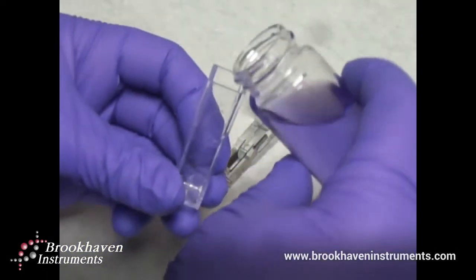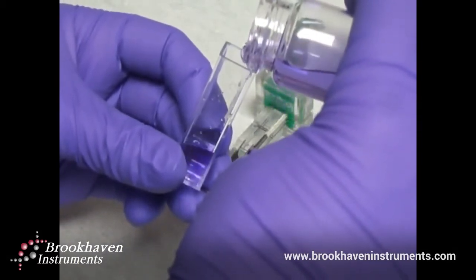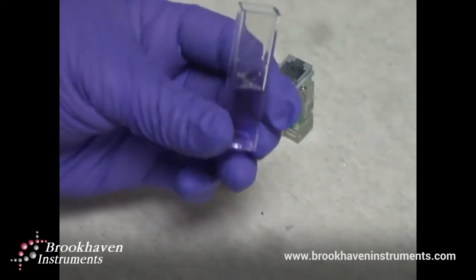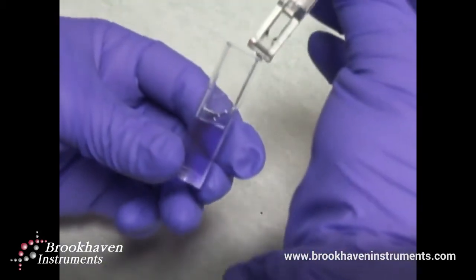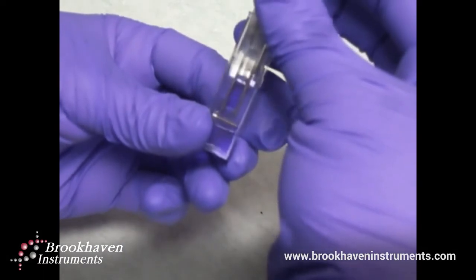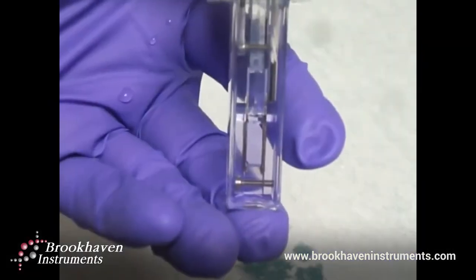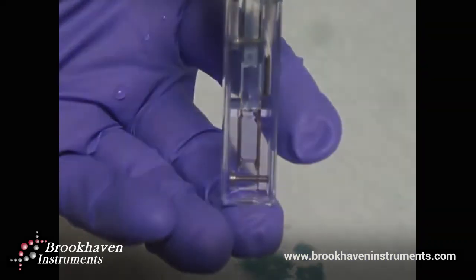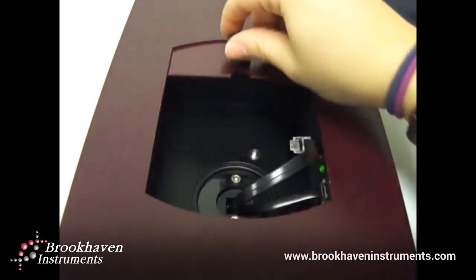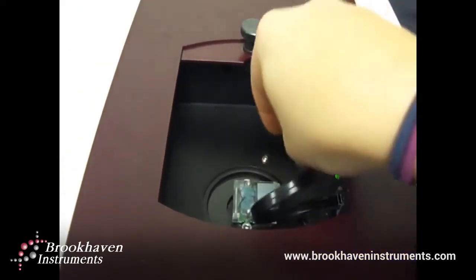Fill a disposable cuvette about a third of the way with sample. Then, carefully insert the electrode so that there are no bubbles formed and that the space between the two palladium electrodes is completely filled with solution. Take the prepared assembly and place it into the cell holder of the Nanobrook and plug in the electrode.